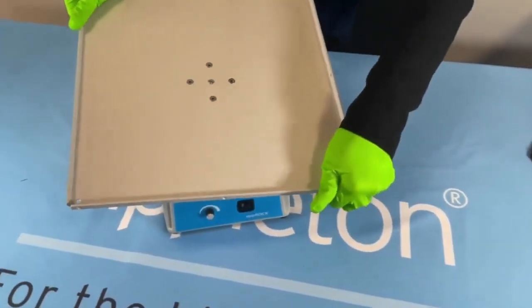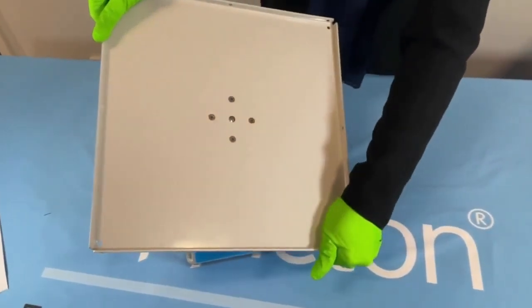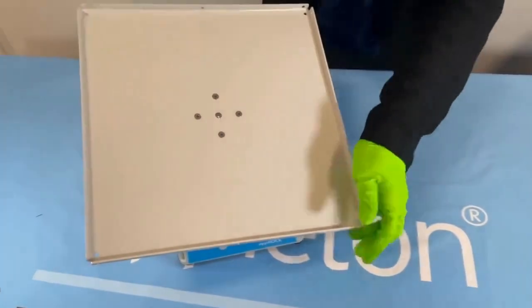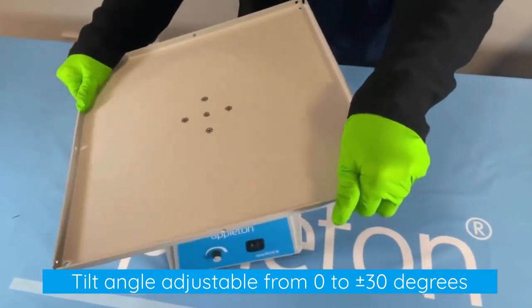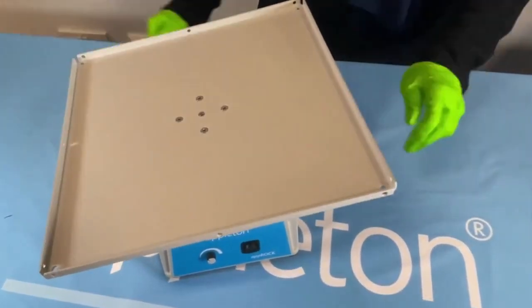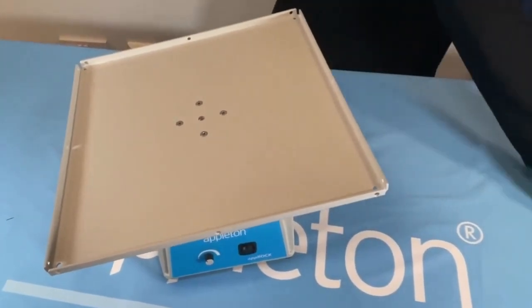To decrease the tilt angle, lift the corner pointed to by the red mark whilst pushing down on the opposite corner. To increase the tilt angle, use the same corners but in the opposite motion.